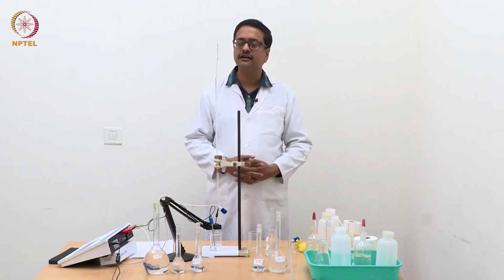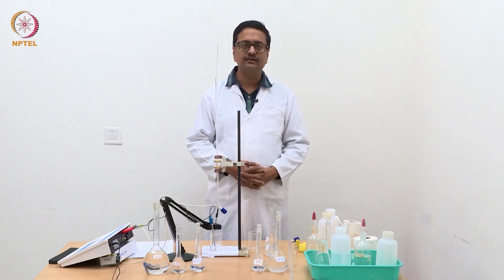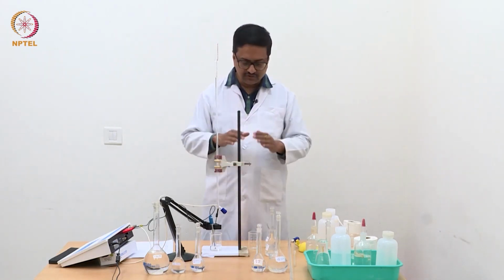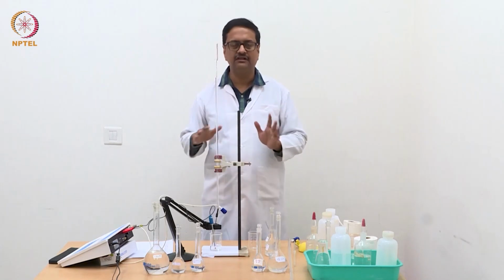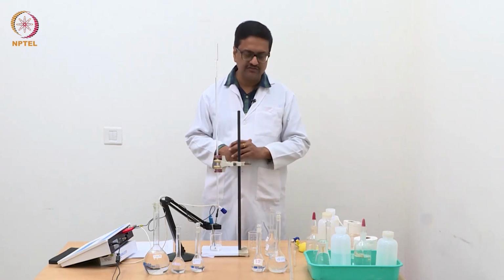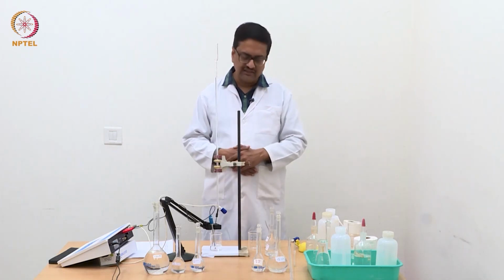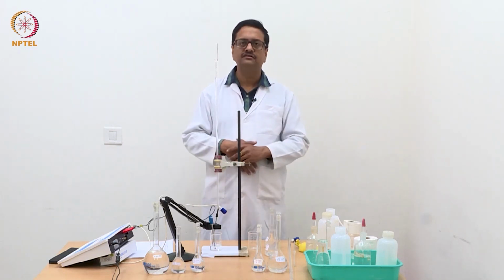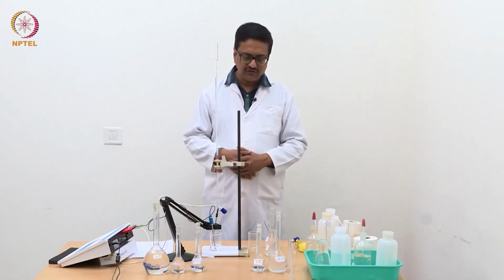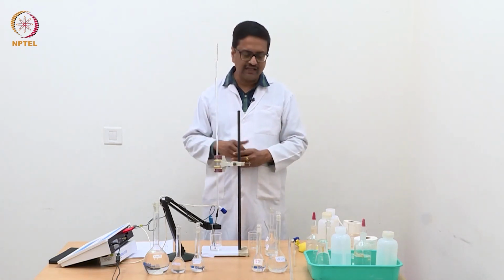When we start a titration of this triple mixture with NaOH, it will first react with HCl, consume H plus and replace it by Na plus ions, and conductance will slowly reduce. We will see a steep decrease in conductance till the H plus ions are consumed. Once H plus ions are completely consumed, then it will start hydrolyzing ammonium chloride and produce HCl, and that HCl will react with the added NaOH. So there will be hydrolysis followed by neutralization of the acid produced.